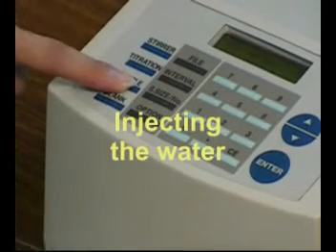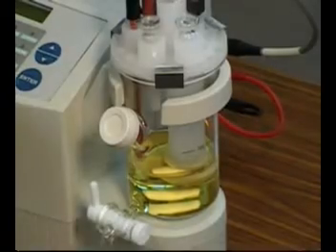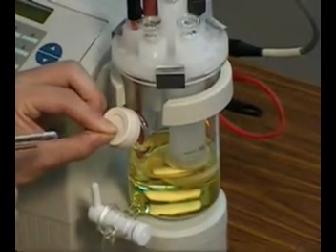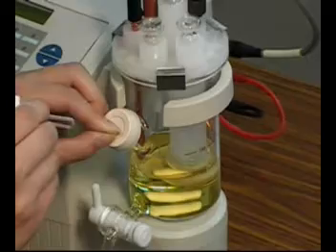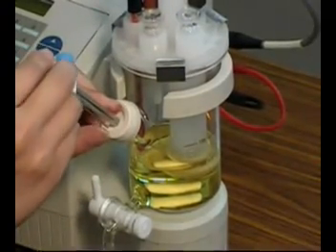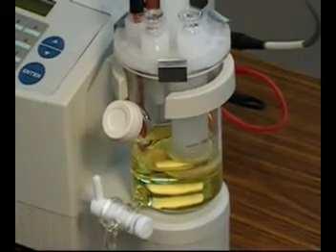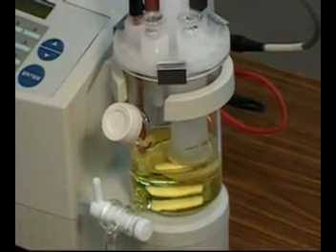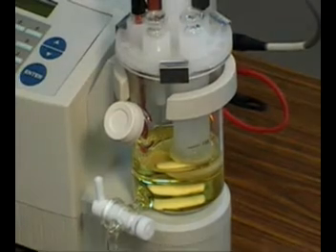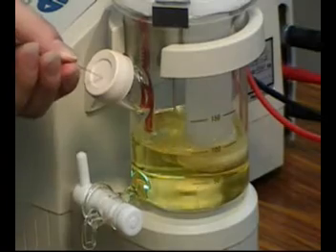Press the sample key. Inject the deionized water into the cell by piercing through the rubber septum. The tip of the needle should go under the anode solution.